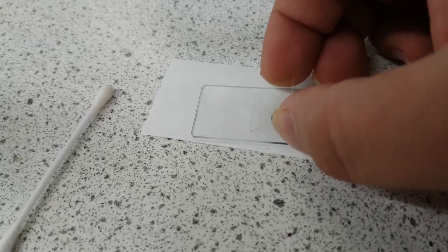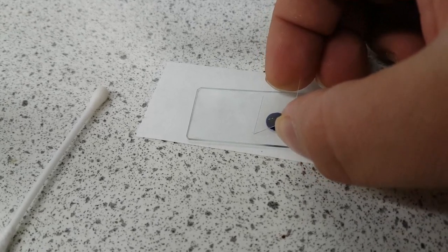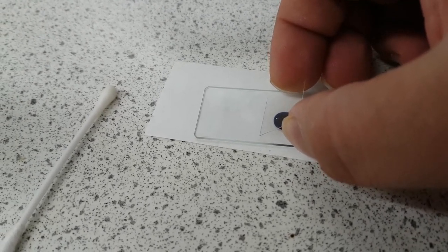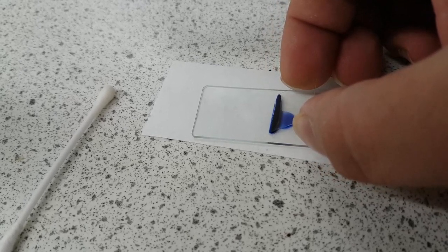Press the cover sheet down on the slide and just move it across and can you see what happened there, it just touched the side.